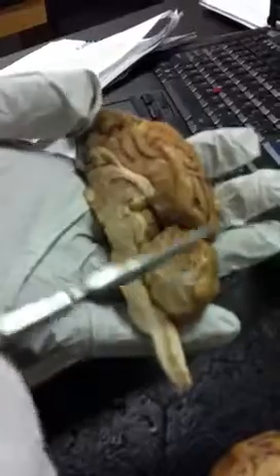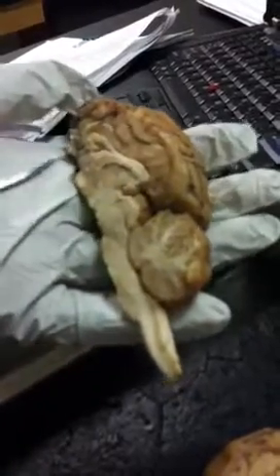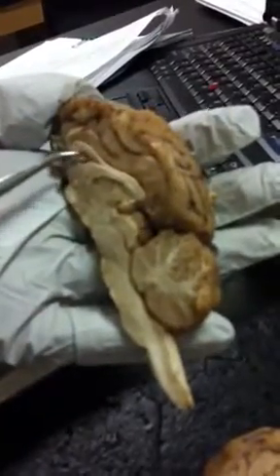And the pineal body, I forgot which one was the inside, right? The pineal body is actually part of the epithalamus. So that's the pineal body right there. But they said that they have a bigger one, right? Than what we have. Okay. I think that's it. That's our brain.